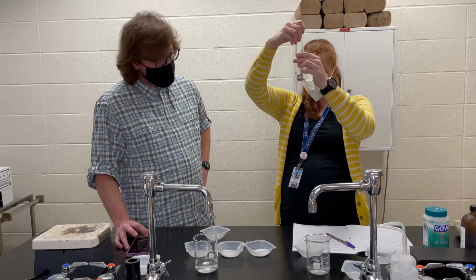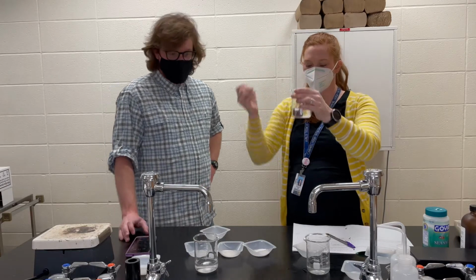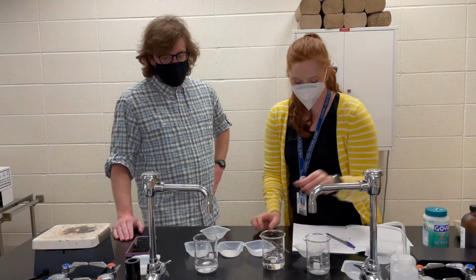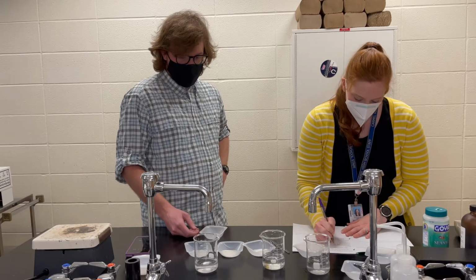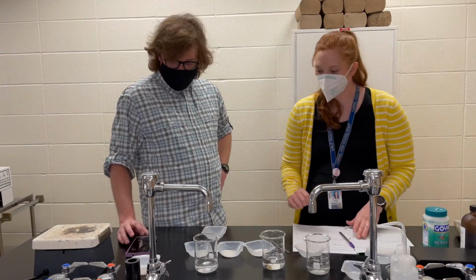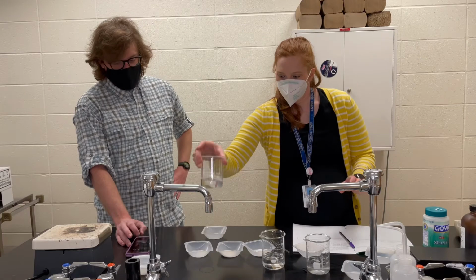And it's gone. That's it. That's where we're at: 11.25 seconds. Okay. And our final setup with our salts.